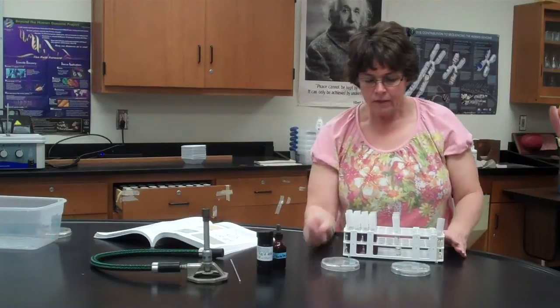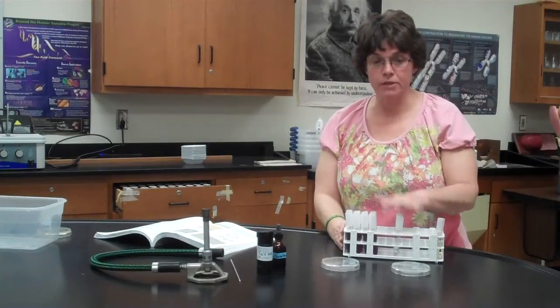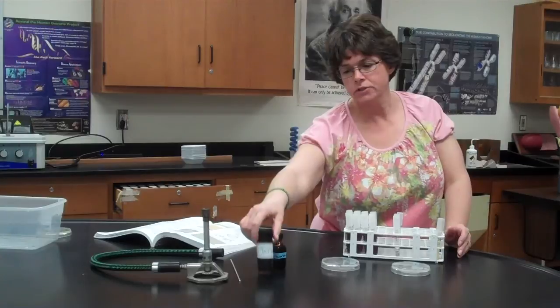You get the same types of waste products, okay? So the other thing that you're gonna have is sterile saline, so it's kind of a saltwater solution. And so for one part, before you start putting them into tubes, the first thing that you're gonna do is make a wet mount. And in this case, you're gonna be using a stain called lactophenol cotton blue.